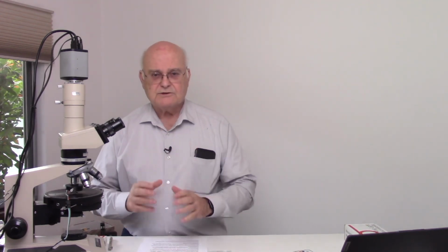We're going to see the bark structure. Bark has a number of characteristic structures. Keep in mind that the purpose of the bark is to protect that thin layer just underneath the bark, which is the actual growing surface of a woody plant. The rings that are formed on a tree, for instance, show the annual growth. The annual growth occurs in this very thin layer just underneath the bark. The bark is trying to protect that thin layer.